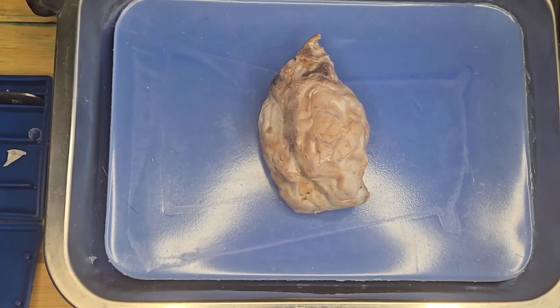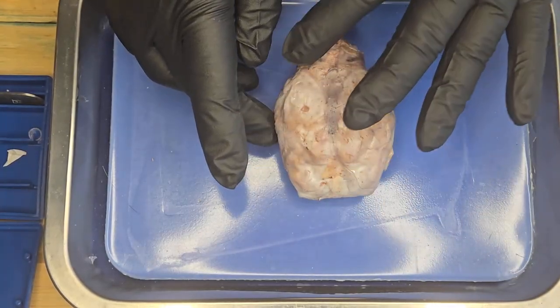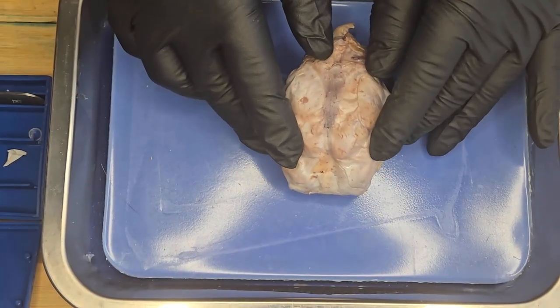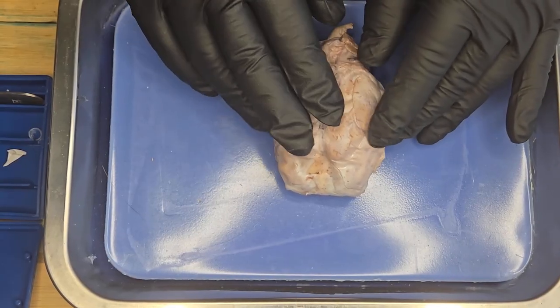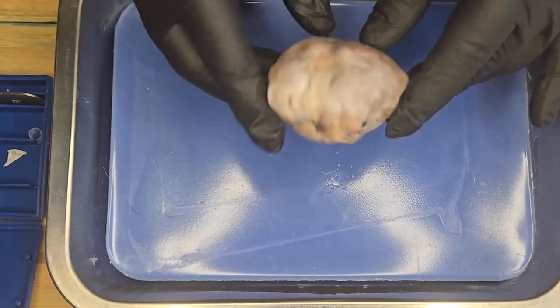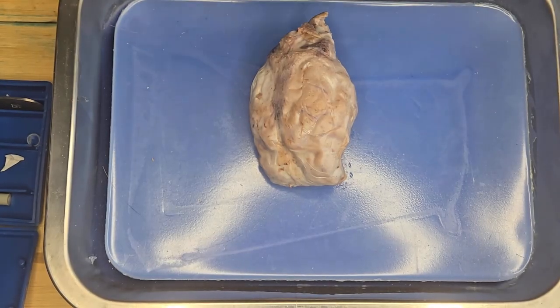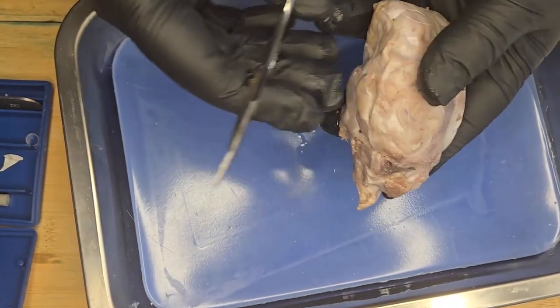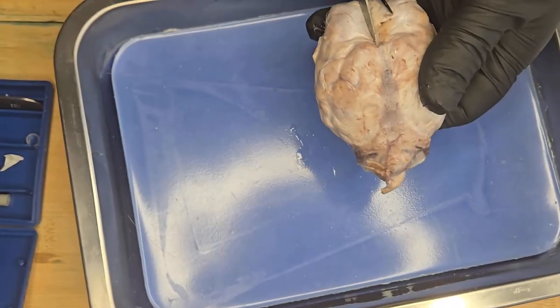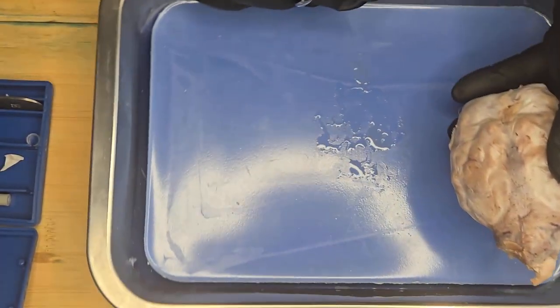So let's get started on the dissection. Okay, so this is my sheep's brain. At the moment, it's got a layer covering the brain. This is called the dura mater. It is a tough connective tissue layer that serves as the outer layer of the meninges. So the first thing is for me to cut and remove the meninges from the brain to expose the brain structure and anatomy. So what I'm going to do first is very gently remove the dura mater.